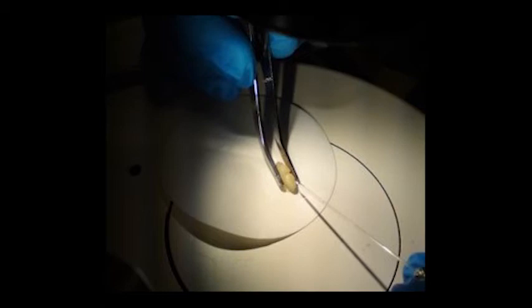This advance to kind of use the bees' natural instincts to be able to remove large numbers of larvae has increased the speed at which we can do this by about tenfold. It's much easier, it's much more repeatable. It doesn't require as many specialized skills to pull them out. And so it's been a big help to us in a lot of our experiments that require us to use viruses.